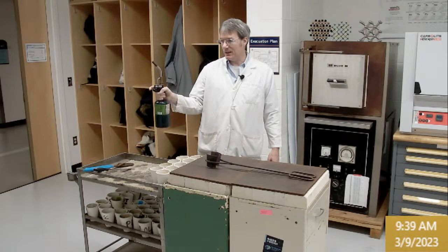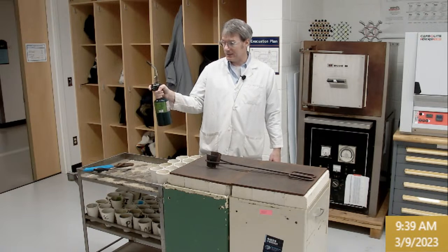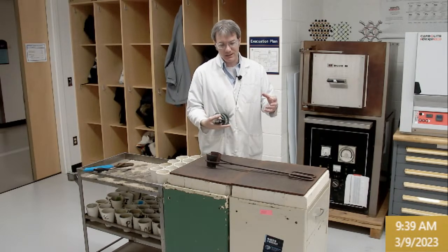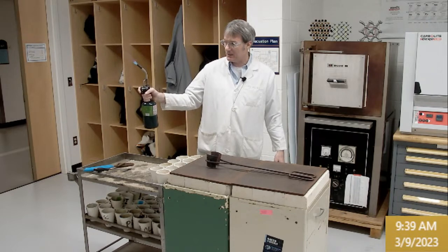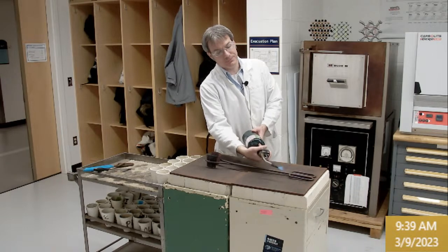And then the piezo, which is clearly malfunctioning part of the time, will ignite it. If you pull too quick, what happens is it starts sputtering on the hot glass, and you think it's ignited, but it's not. It's igniting on the hot surface. So make sure you pre-ignite and then move in like this.